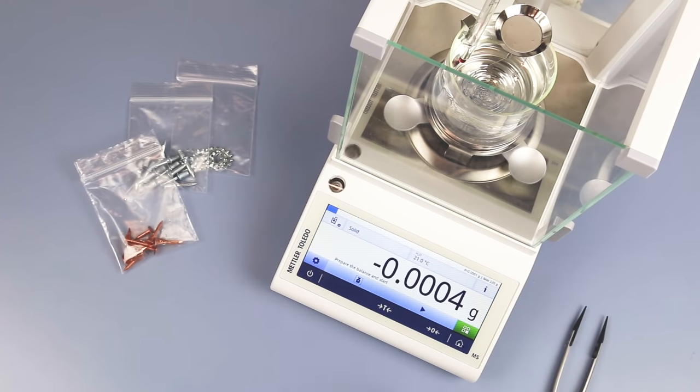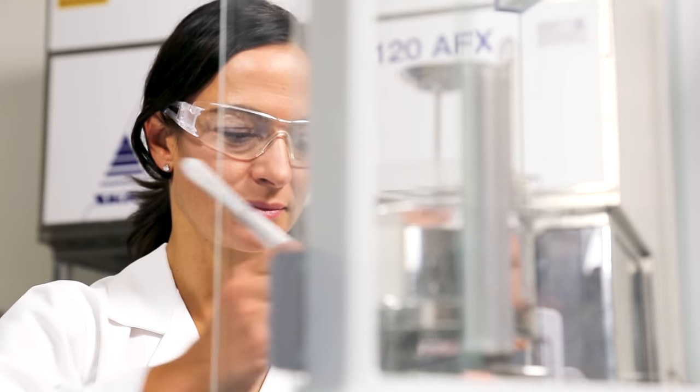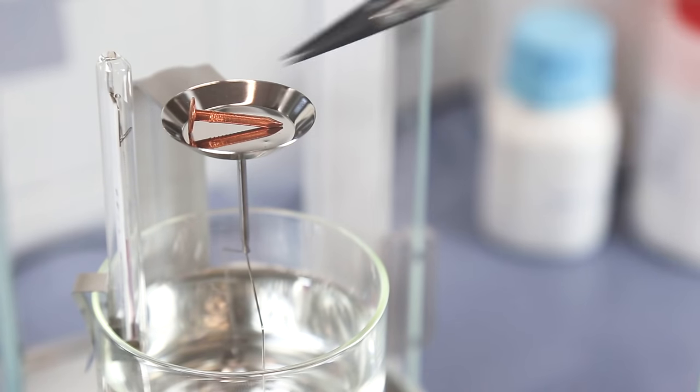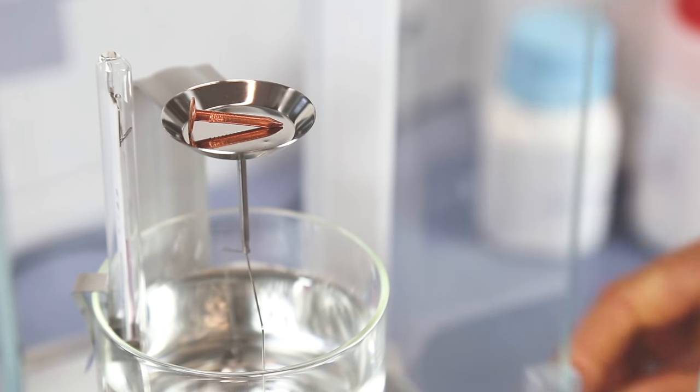Step-by-step instructions guide you through the entire process. For solid samples, the object is first weighed in air and then in a liquid of known density.